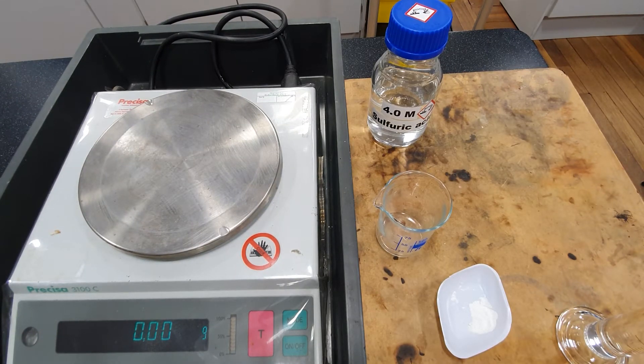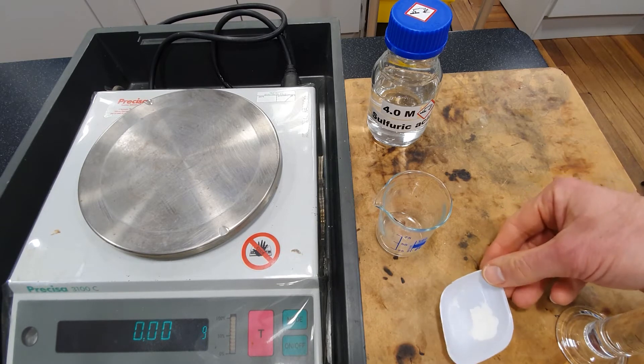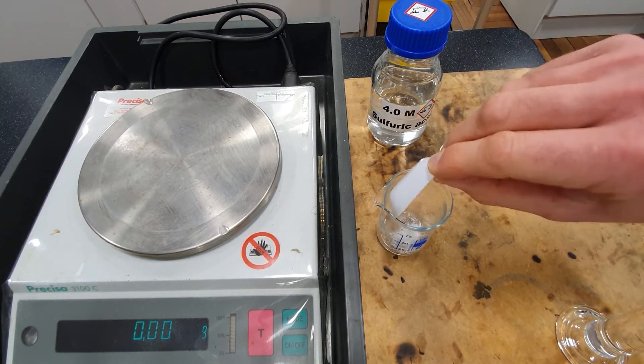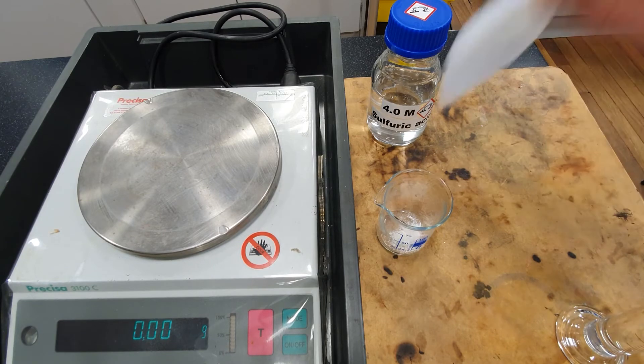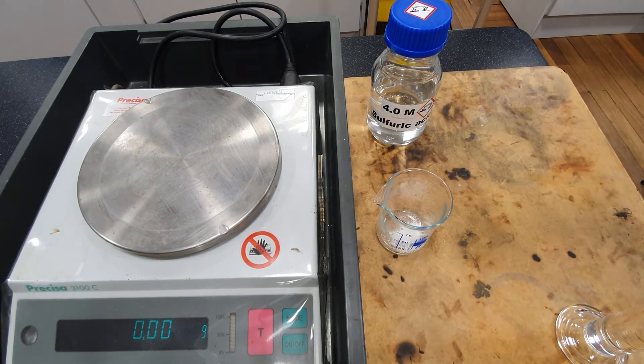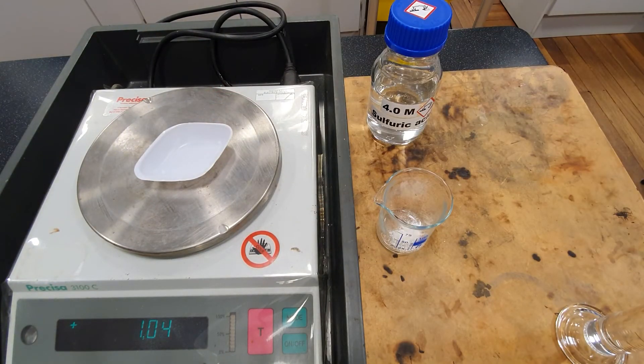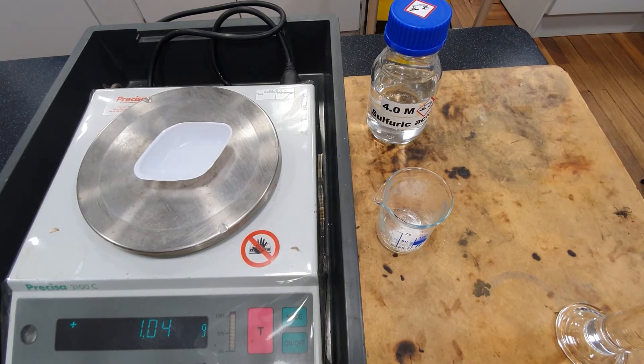Empty the crushed tablet into the small beaker and re-weigh the weighing boat. Record its mass.